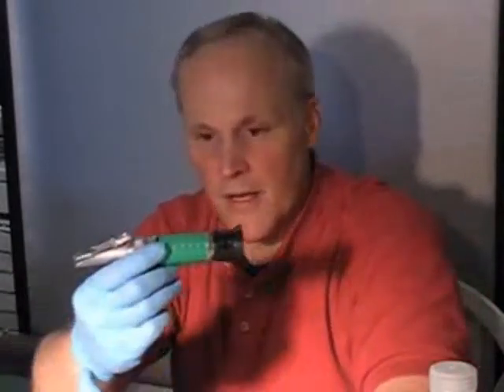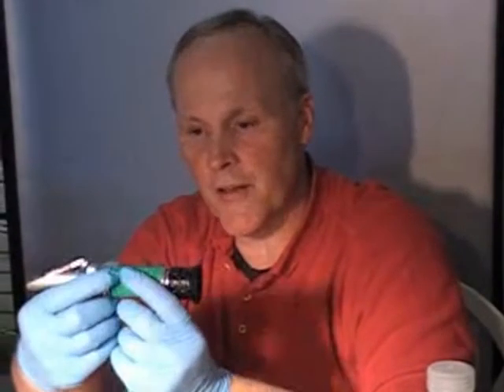Okay folks, I'm going to start by testing the sugars now. I'm going to be using the refractometer, the little instrument we showed you before. This is the VG, the BTX1.